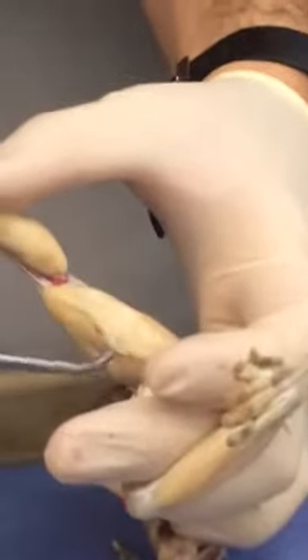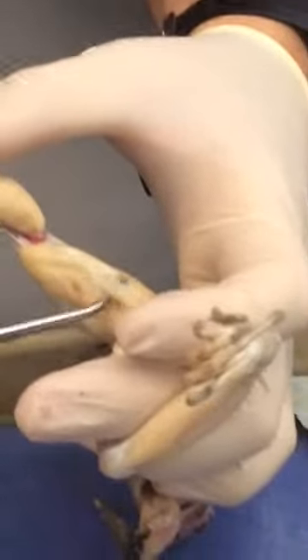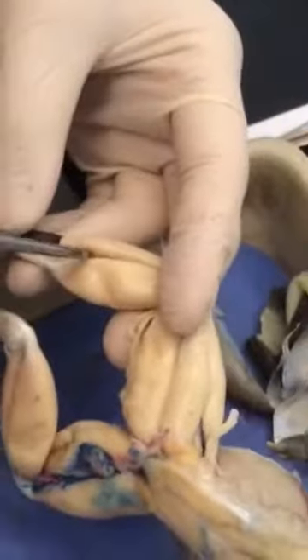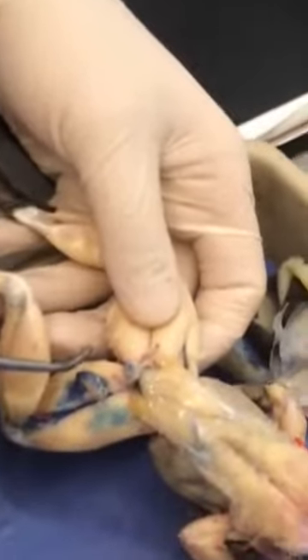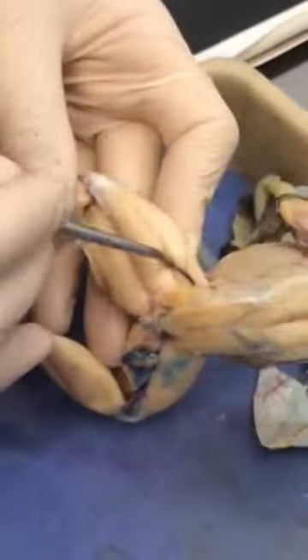This one unfortunately, but you can see this is the gracilis minor. You need to know the gastrocnemius, which is right here. You need to know the peroneus, which is on the other side, right here. You need to know the semimembranosus.